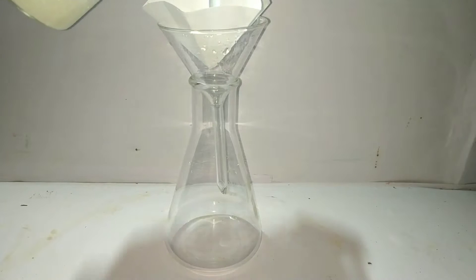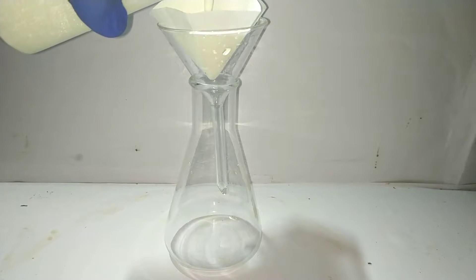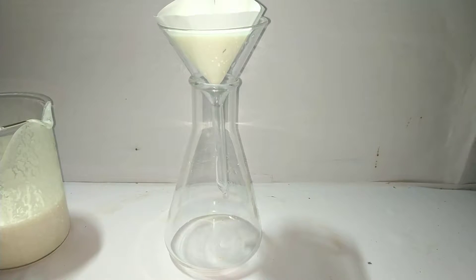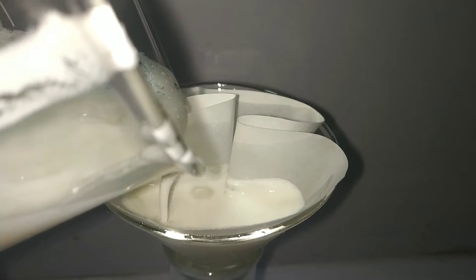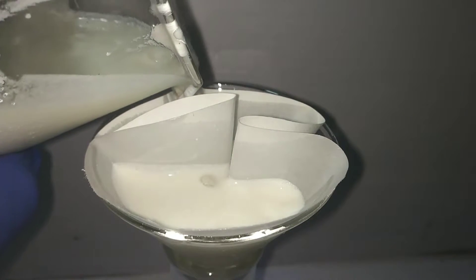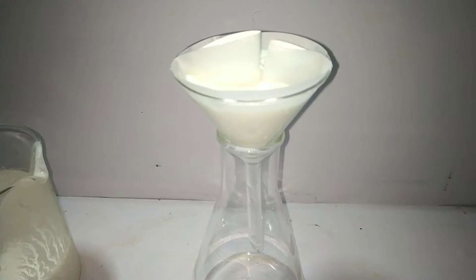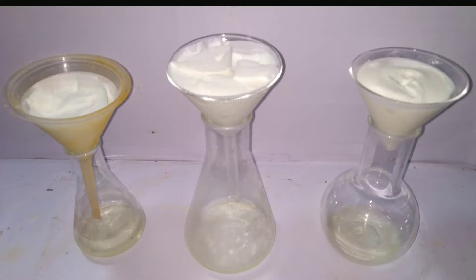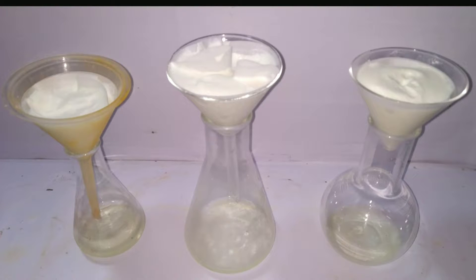After 15 minutes, filter the solution and collect the crude precipitate. I am using a simple gravity filtration method here. We have to wash the crude precipitate a couple of times with cold distilled water to remove the excess acid. Since the particle size is very small, it took a lot of time to filter, so I set up filtration in two additional flasks simultaneously.